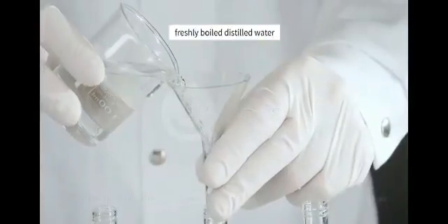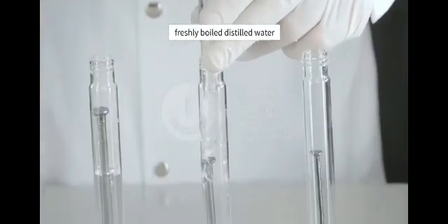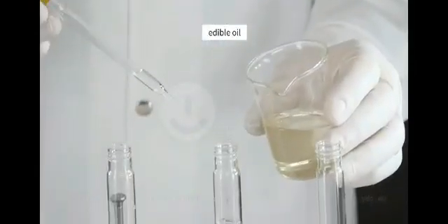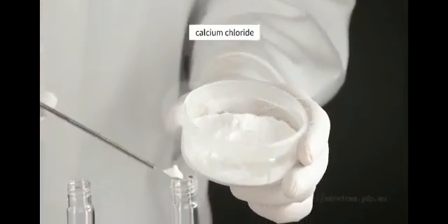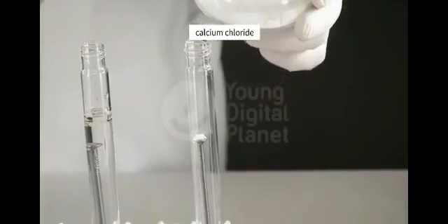We add freshly boiled distilled water. It contains less dissolved gases from the air, and a little edible oil to the third test tube. The layer of oil will prevent the air in the test tube from dissolving in the water. We add calcium chloride, which will absorb the water vapor present in the air, to the 4th test tube.